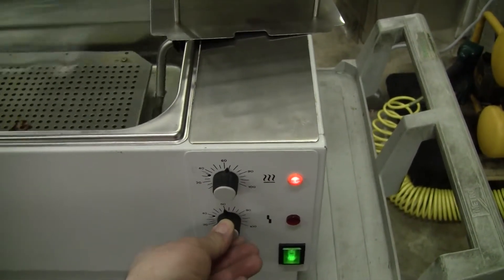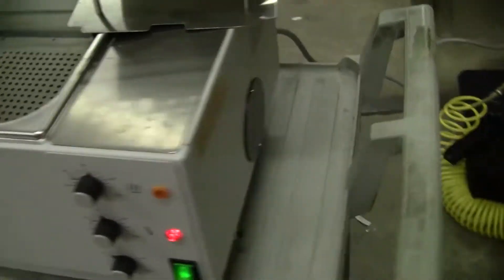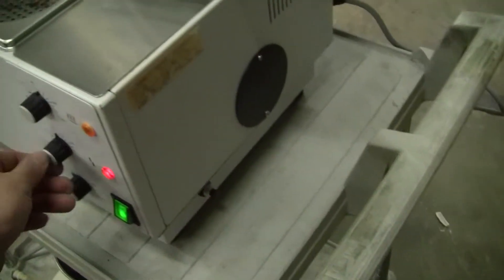Here's the over temp. You'll watch the unit shut off, actually. The reset button's on the side. Gotta turn it up first.